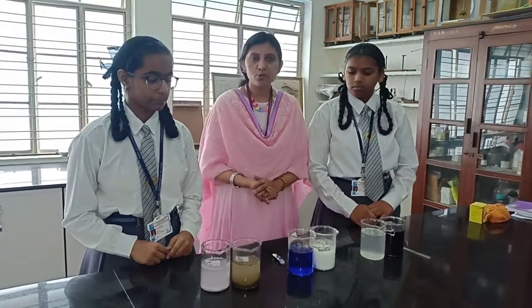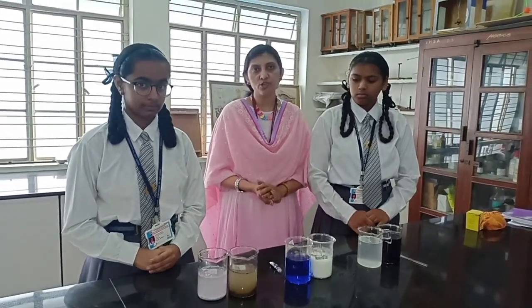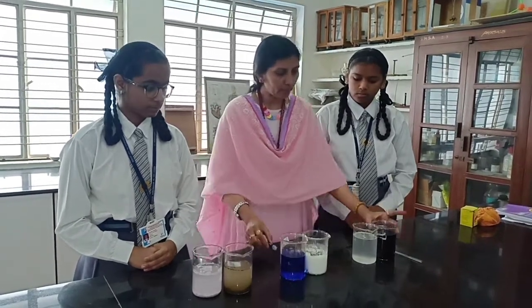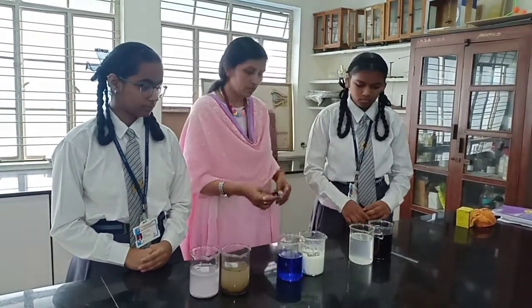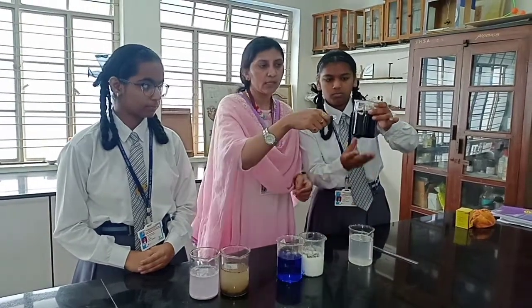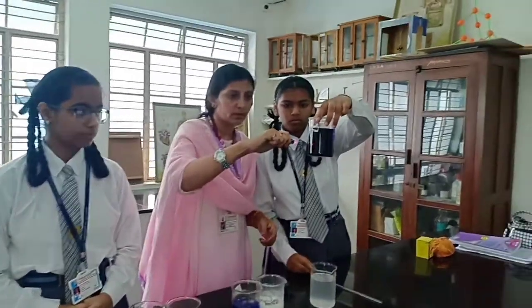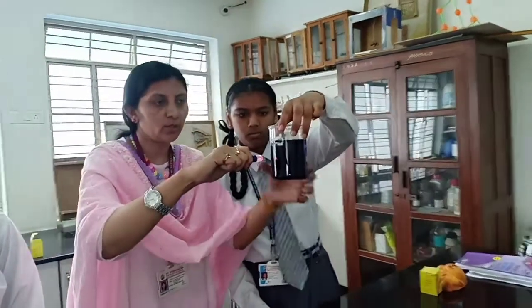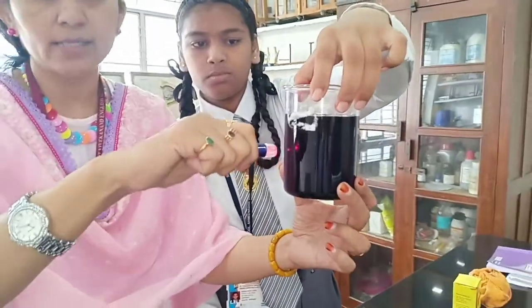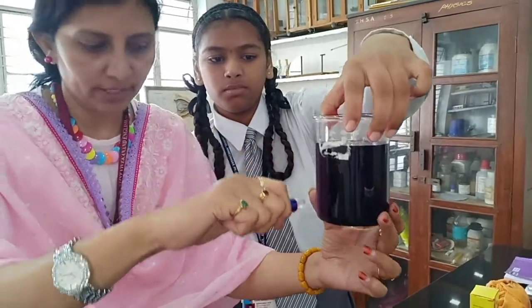Now I will show you the Tyndall effect and how to identify the heterogeneous and homogeneous mixture with the help of potassium permanganate solution. Now you will see — I will pass the beam of light. Come closer so that you will see — are you able to see the beam of light passing? In this it is not passing the beam of light.